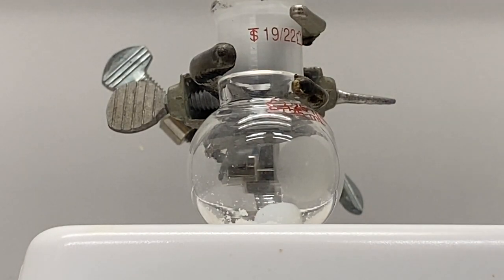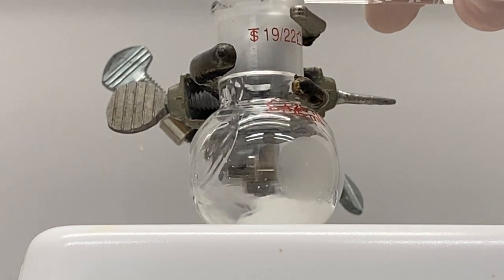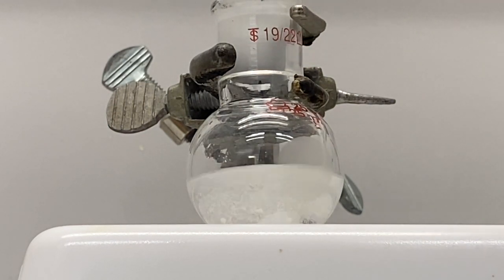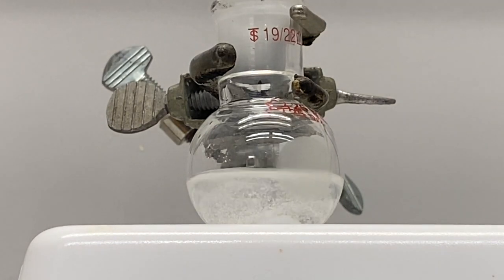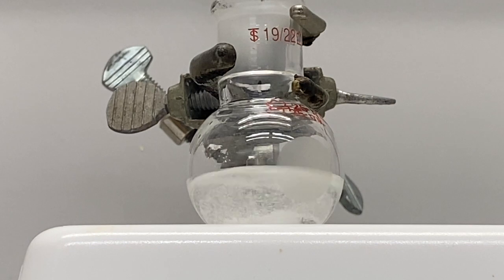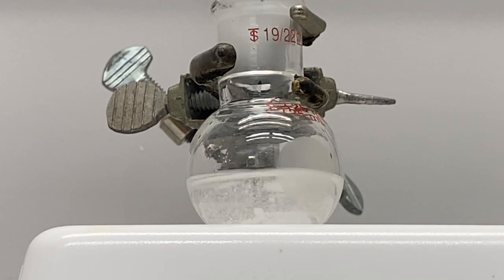Now we want to add our ethanol. It'll be a little cloudy. We're going to give this a few minutes to stir, to dissolve the solid, and make sure that all that solid is dissolved in solution. And then we'll add our aldehyde, so let's stir for a bit.